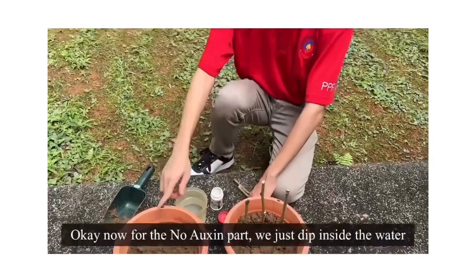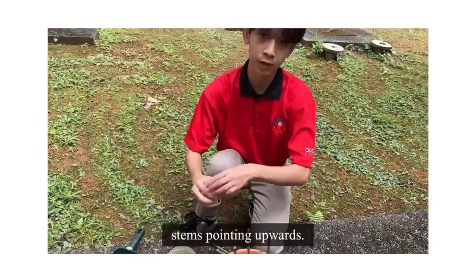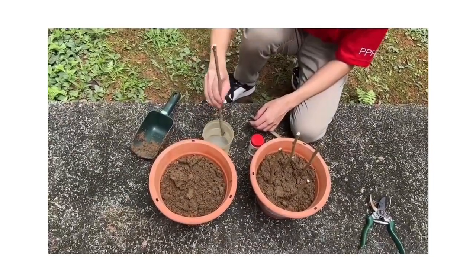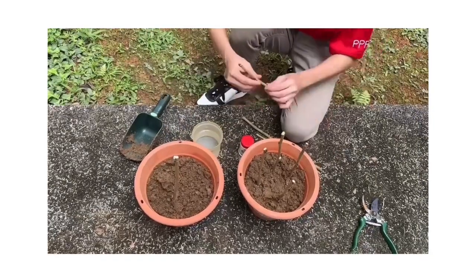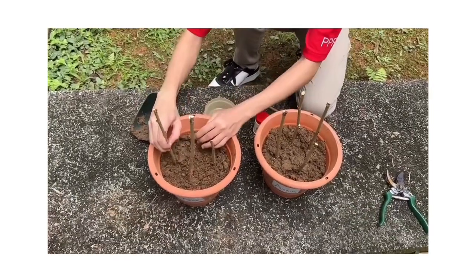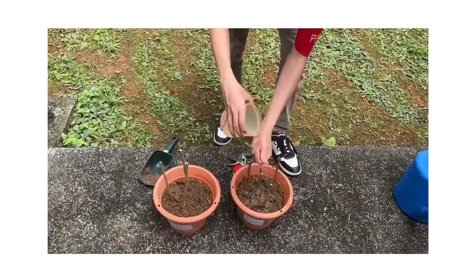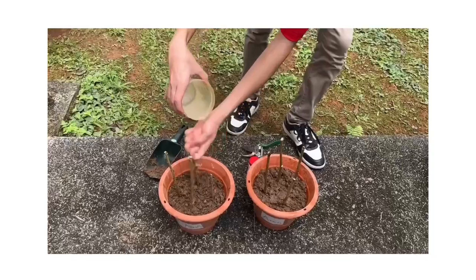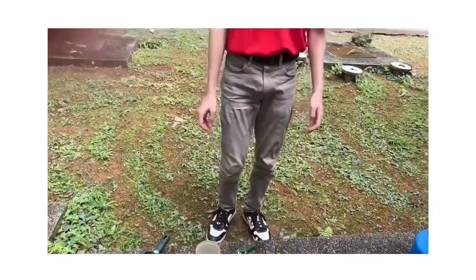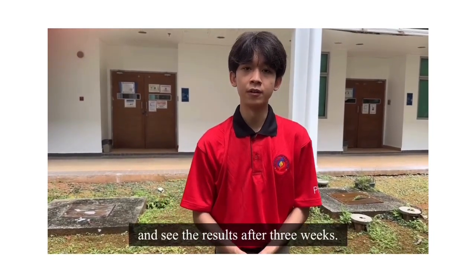Okay, now for the no auxin part, we just dip inside the water, with all the stems pointing upwards. Planted this, so we need to wait for 3 weeks for it to grow and see the results after 3 weeks.